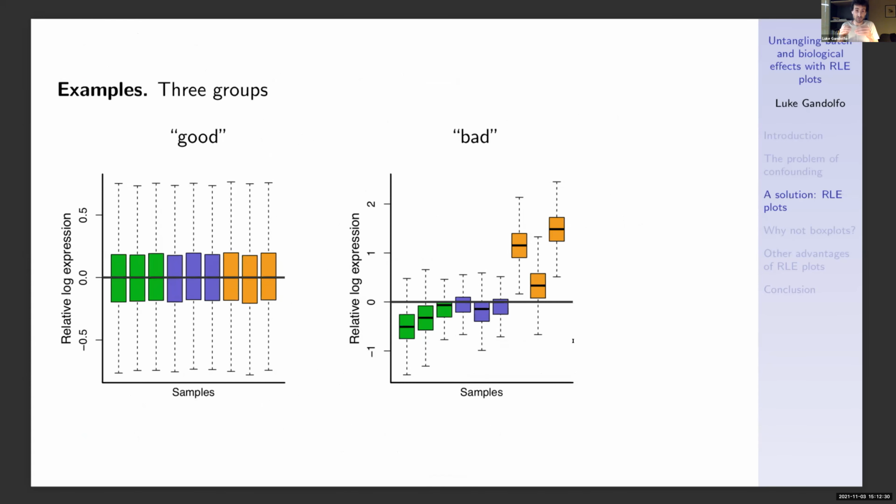So to get a bit more of an idea of what's going on here, here's some cooked up examples. And here is an RLE plot that looks good. It's indicating that there are no technical effects, and that is the medians of the boxes are centered on 0, and the boxes are roughly the same size. And on the right is a very bad RLE plot where we don't have the median centered on 0 and the boxes are all over the place. That is an RLE plot that's strongly indicating that we've got serious technical effects here.